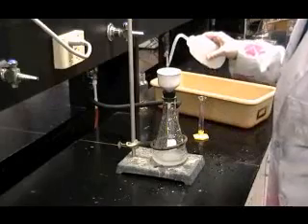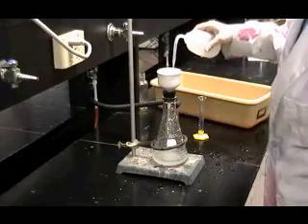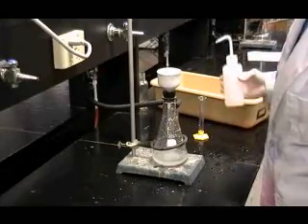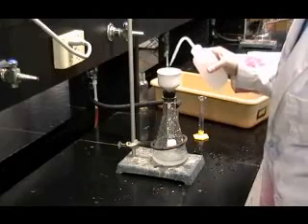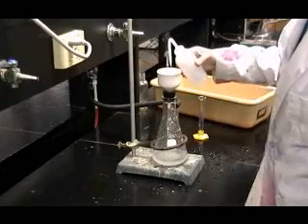Then, after 2 or 3 additional minutes, use your wash bottle to gently wash the aspirin with sprays of ice cold deionized water for a total of 30 seconds.